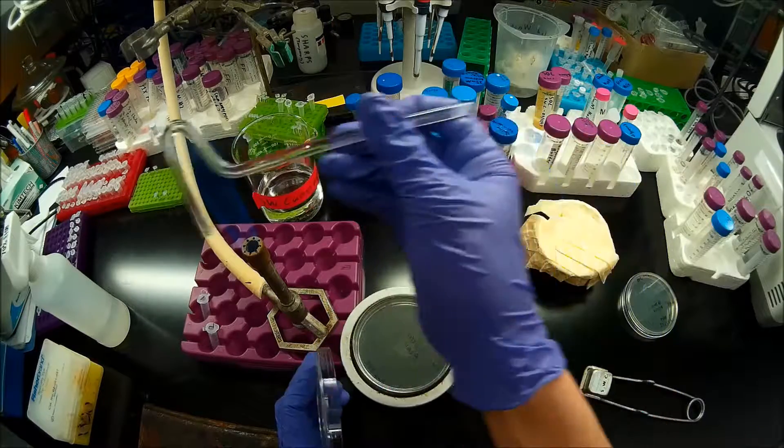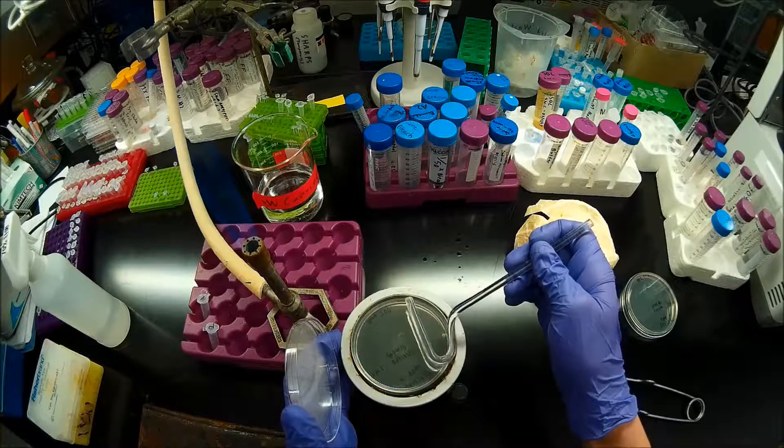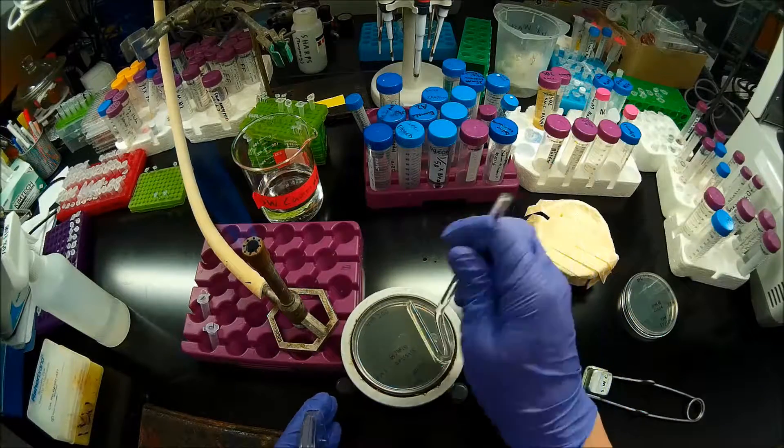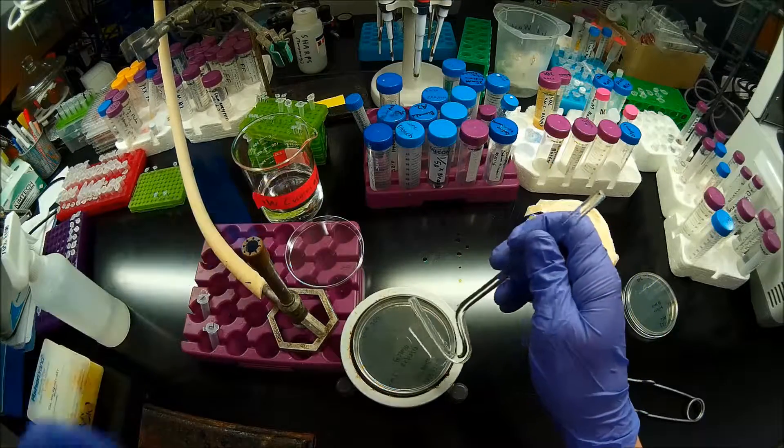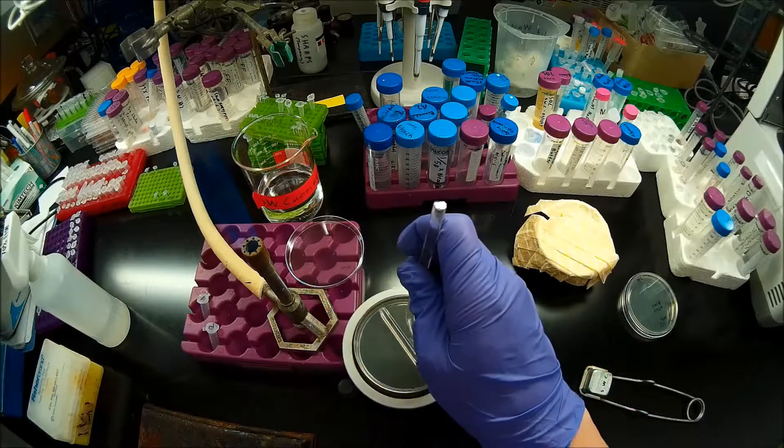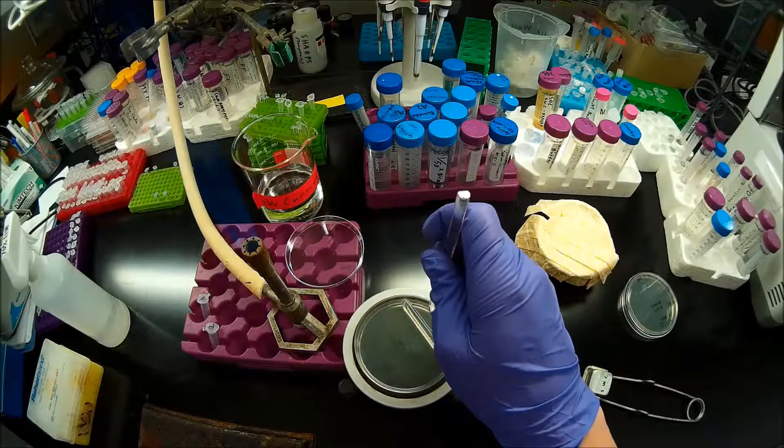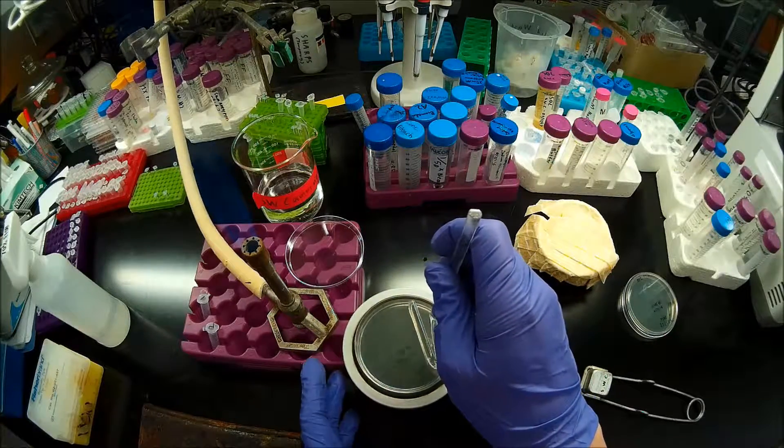So same thing, right? I don't want to put the hot spreader on my cells because that would kill my cells. So I'm going to put it over here on the agar. Rock it back and forth. And now I'm going to spread my transformed cells on the plate. There we are.